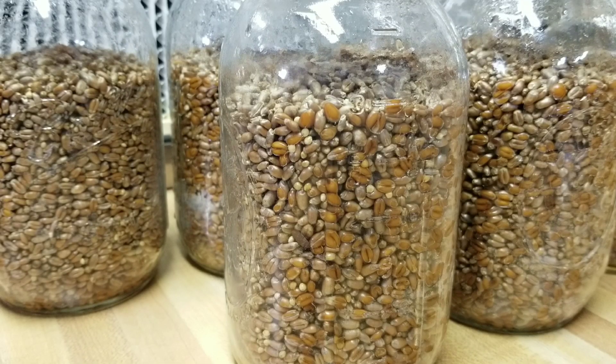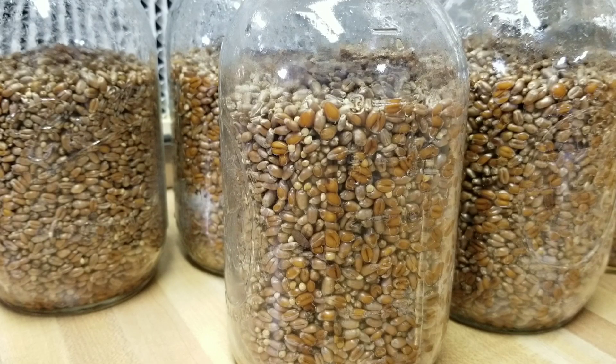These differences will be even more severe if you pull the jars out early before they've completely cooled. If you pull them out while still warm into a cool room, you're just gonna get more condensation and more wet kernels. That's why I prefer to allow them to cool in the pressure cooker overnight - that kind of mitigates the moisture inconsistencies.